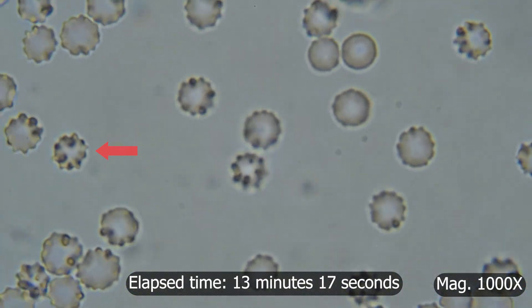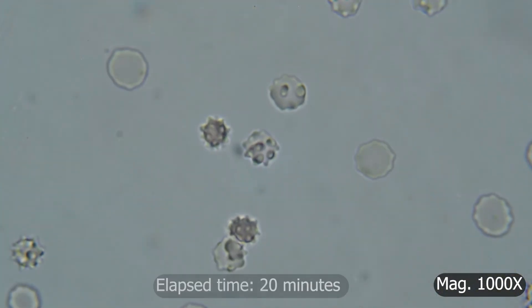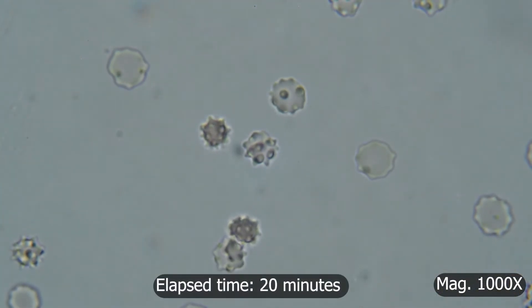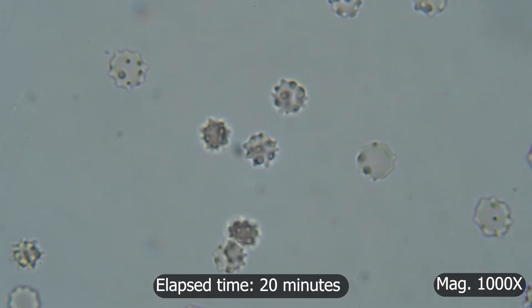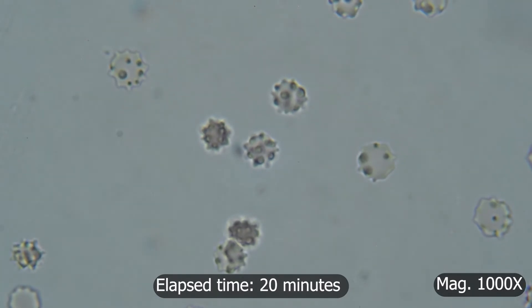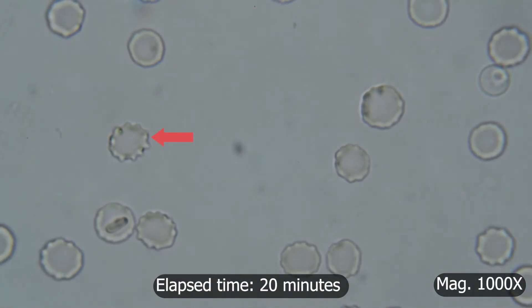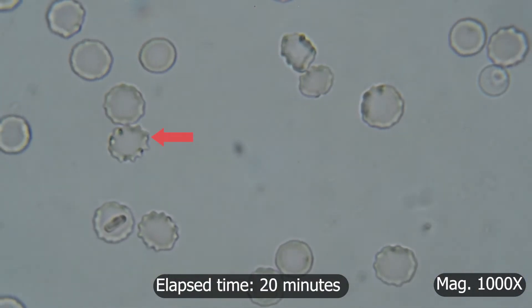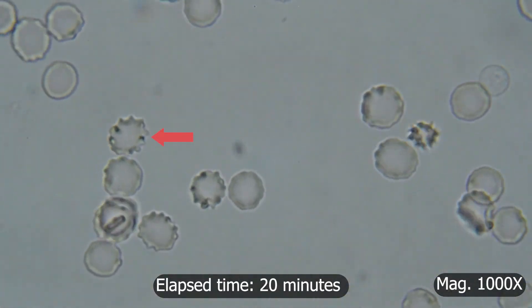Crenated cells can occur artificially as seen here, and they could also be present in some diseases. It is rare to see crenated red blood cells in a hydrated, healthy animal.